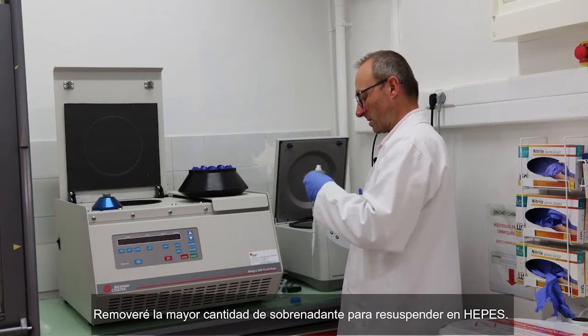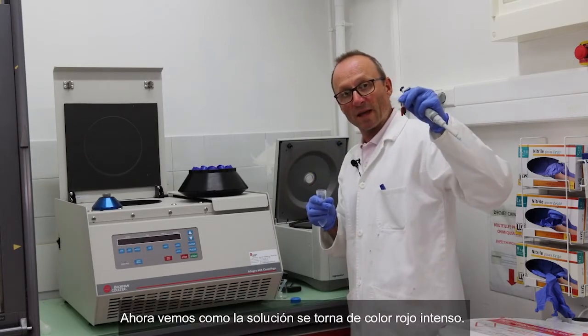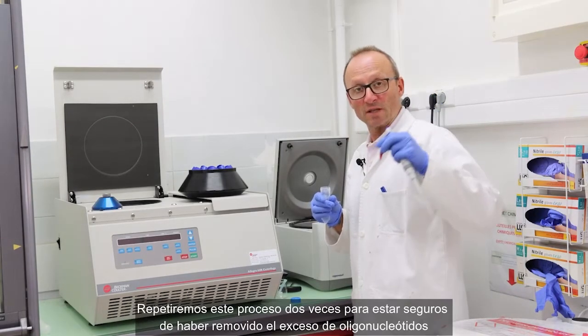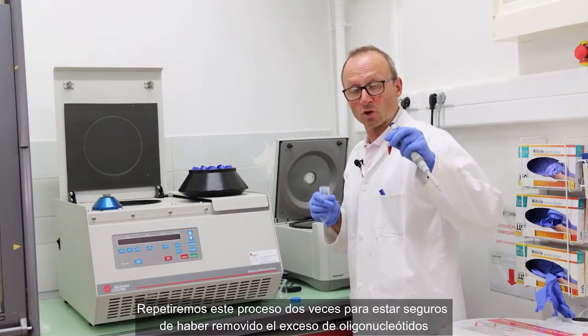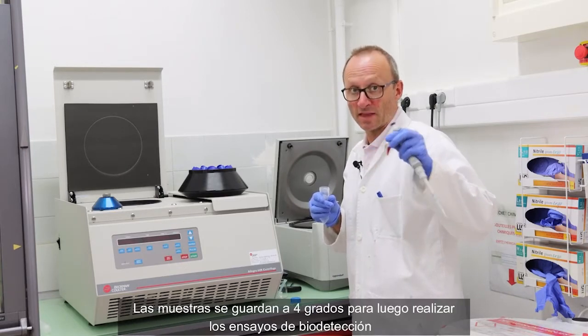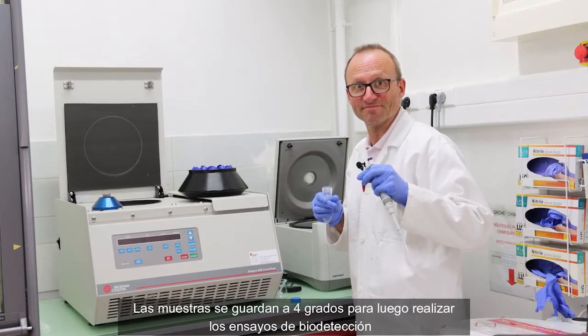Resuspend the sample in HEPES. And now I get the deep red color. Okay? You will repeat this step twice to make sure that you totally removed the excess of oligonucleotide. And then you can store the sample at 4 degrees before running the biosensing assay.